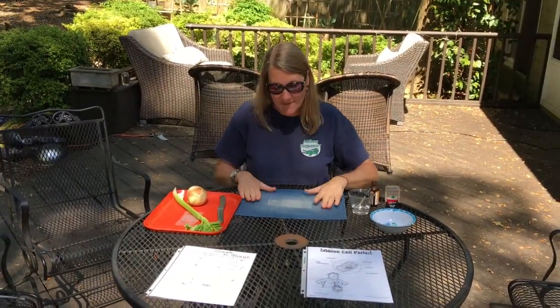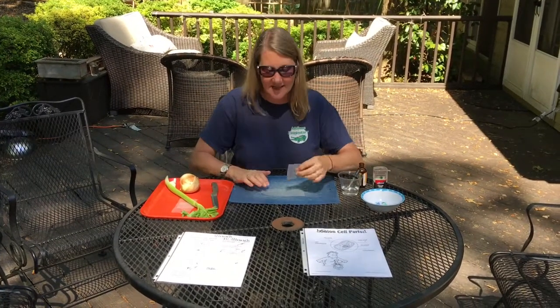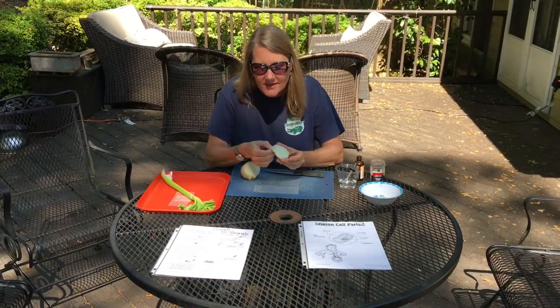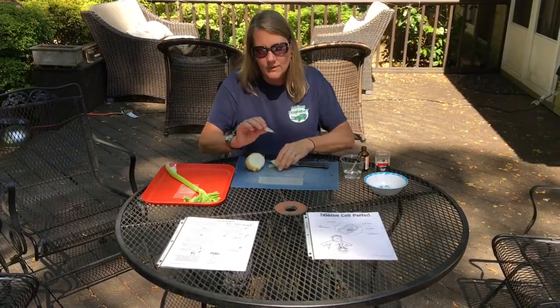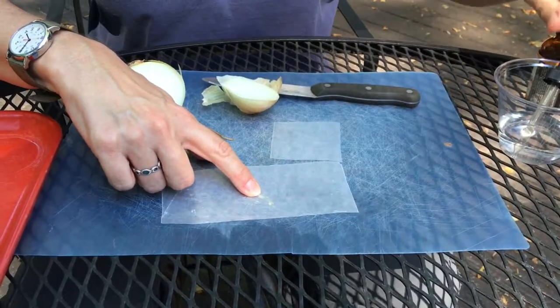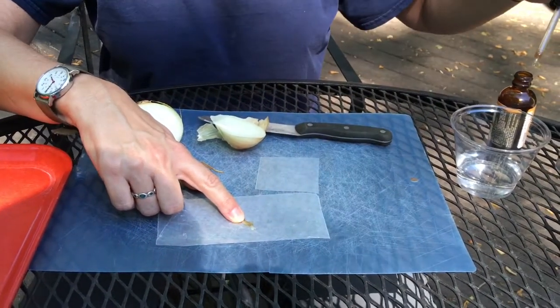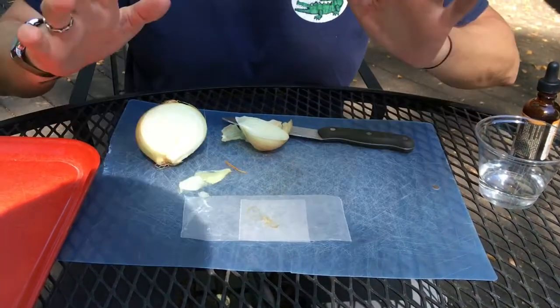I didn't bring a microscope home from the science lab or slides, but I've made these gigantic slides just to remind you how we made the onion skin cell and the cheek cell. So imagine this was a slide. We sliced an onion and found the skin — a little piece of the skin, one cell thick. We added a little bit of stain called iodine to the slide, and that helped us be able to see all of the parts of the cell inside. We put a cover slip on the top and put it under the microscope.